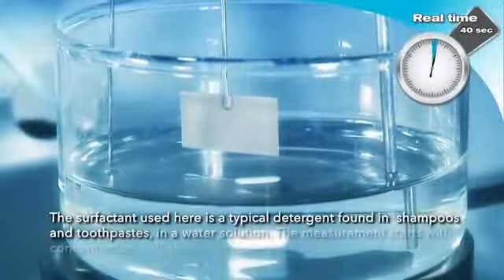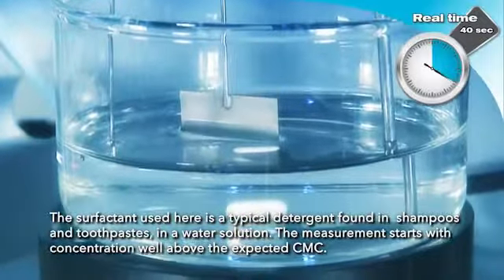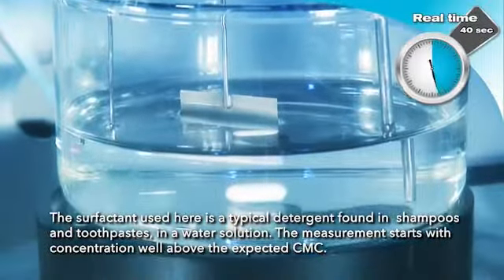The surfactant used here is a typical detergent, found in shampoos and toothpastes, in a water solution. The measurement starts with concentration well above the expected CMC.